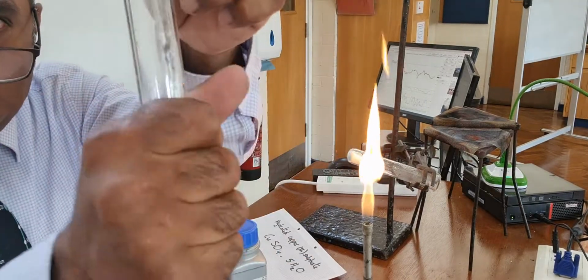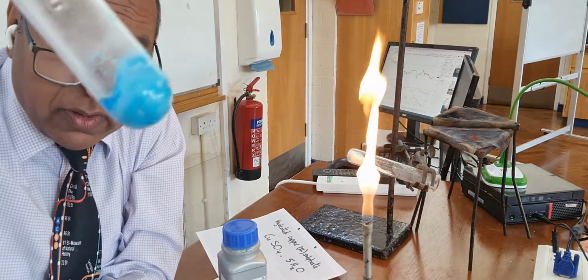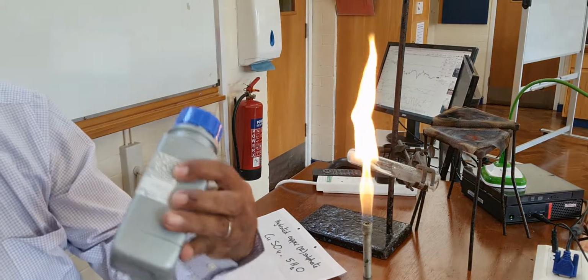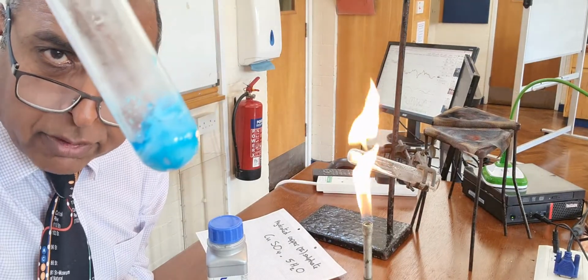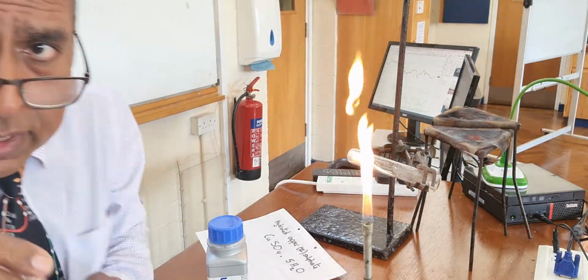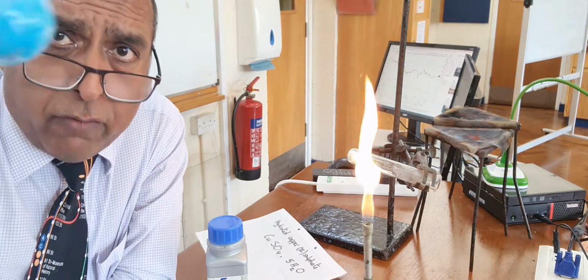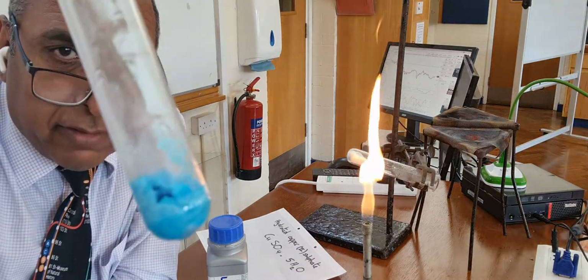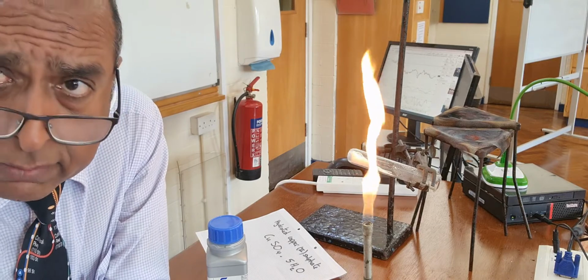And as you do that, that test tube gets hot because it's an exothermic reaction. Lots of heat comes off. So you've turned your anhydrous copper sulphate, which was white, into hydrated copper sulphate. By adding water, the water gets locked inside the solid of your copper sulphate and makes hydrated copper sulphate. And that's the most famous example of water of crystallization.